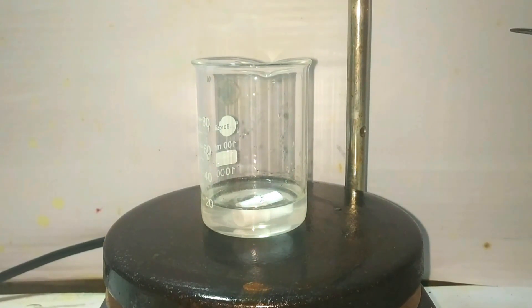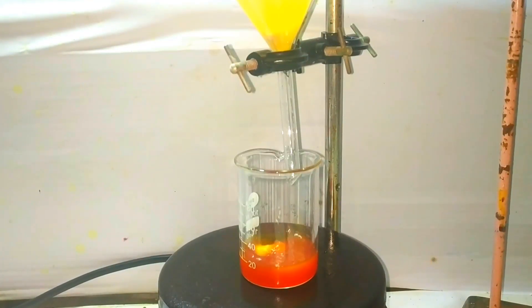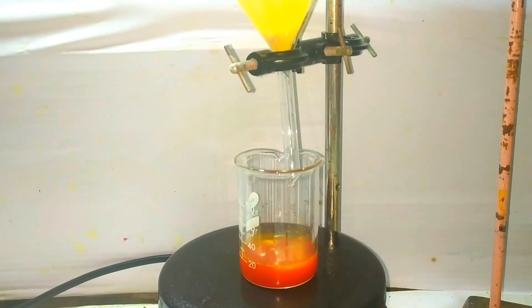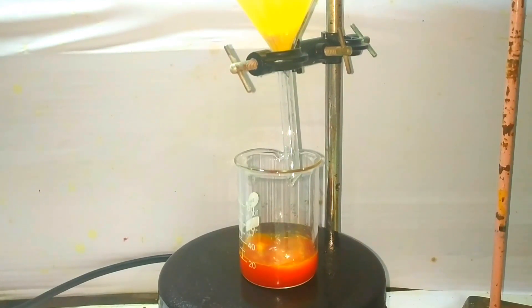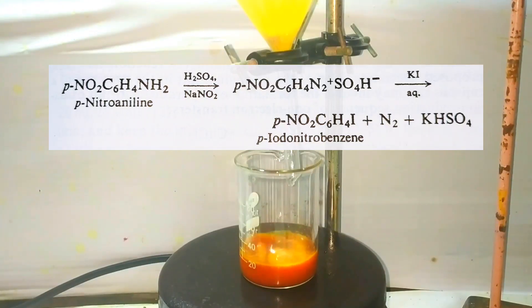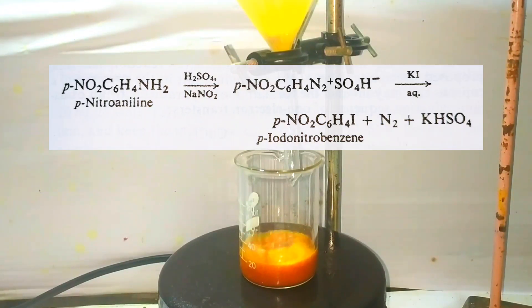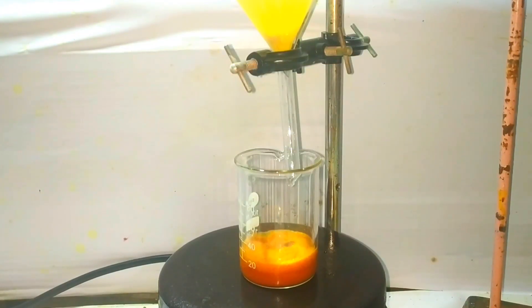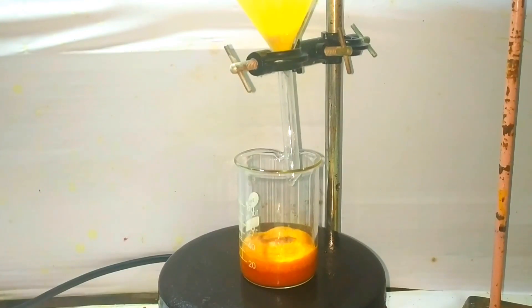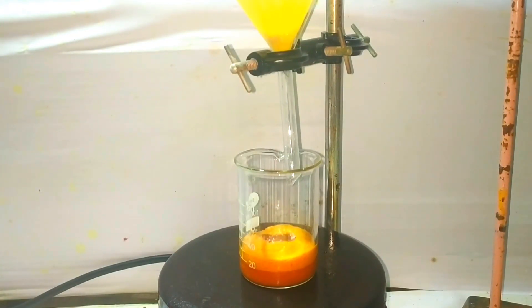The contents of the round bottom flask are then placed in a separatory funnel and added into the potassium iodide solution with constant stirring. You can see a vigorous reaction taking place with evolution of a lot of vapors. It foams up a lot, but it will all settle out fast. If foaming is too uncontrolled, use a larger beaker. The gas produced is nitrogen gas.